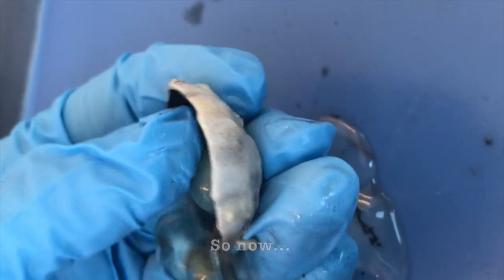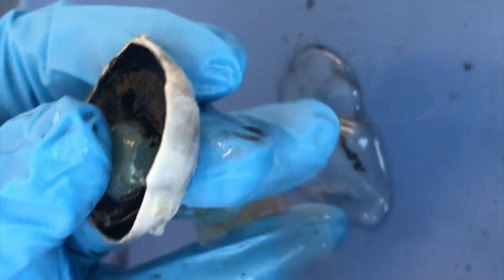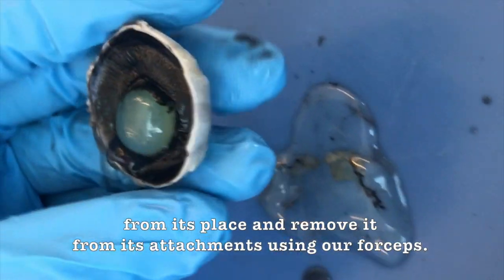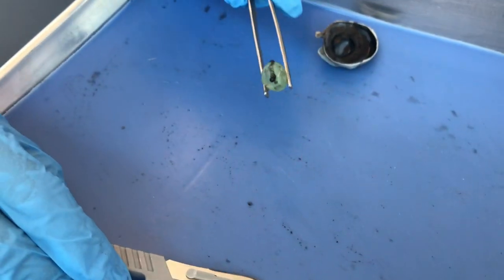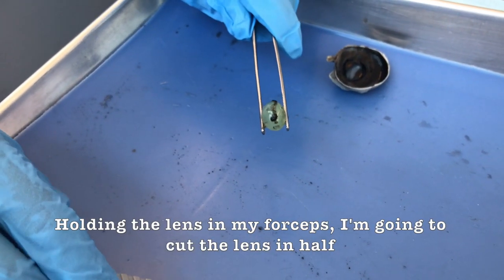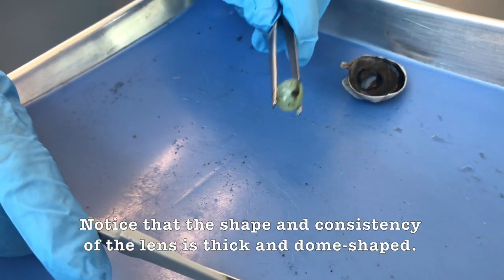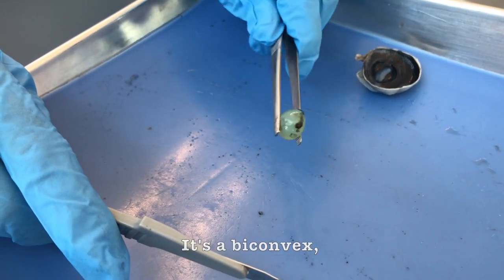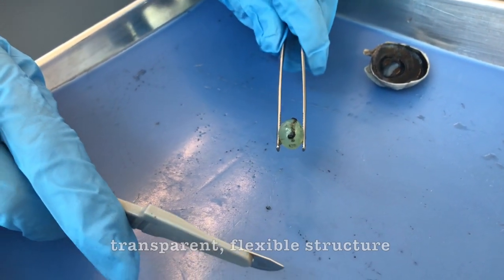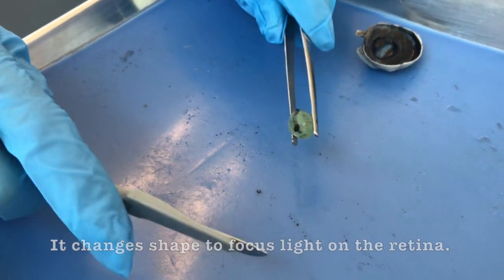So now I'm going to pop the lens from its place and remove it from its attachments using our forceps. Holding the lens with my forceps, I'm going to cut the lens in half using my scalpel. Notice that the shape and consistency of the lens is thick and dome-shaped. It is a biconvex, transparent, flexible structure enclosed in an elastic capsule, and it changes shape to focus light on the retina.